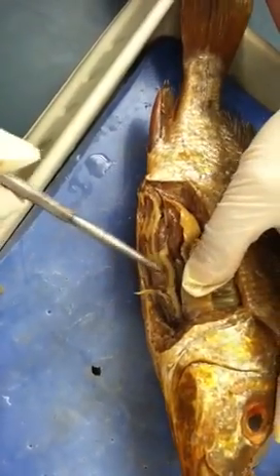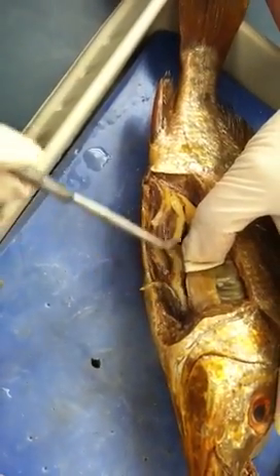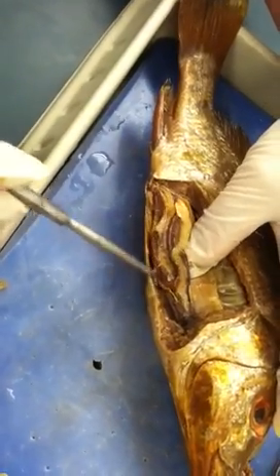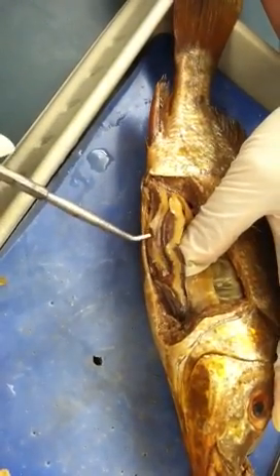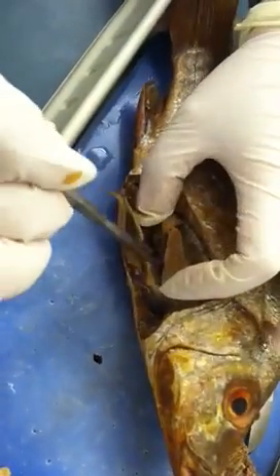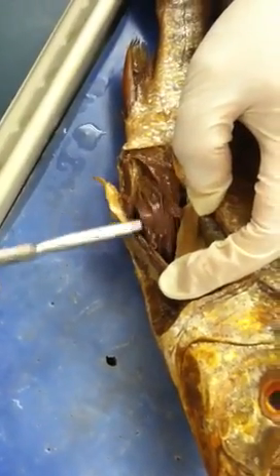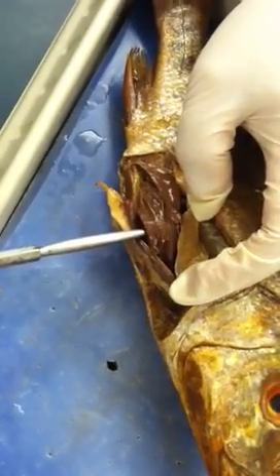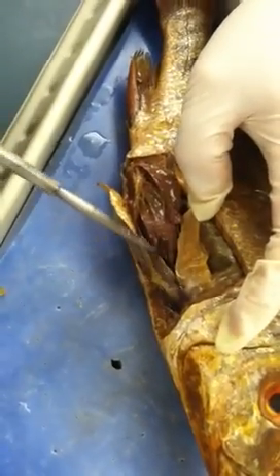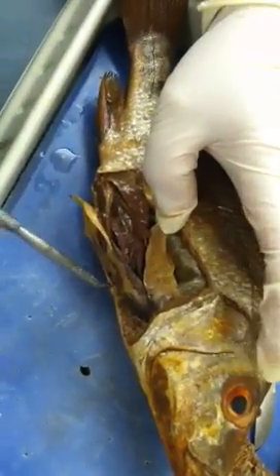And you go further down — now we have to go into the digestive system. You will see this winding tube-like structure that connects all the way to the anus; that will be the intestines. And if you remove the intestine and go deeper, you will see a sac structure embedded inside the fish — that's the stomach. So the starting point is the stomach, then intestine going all the way to the anus.